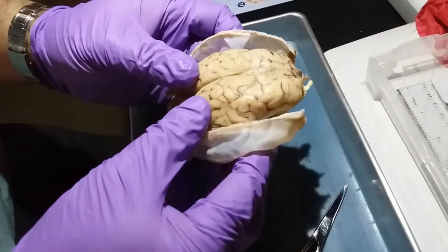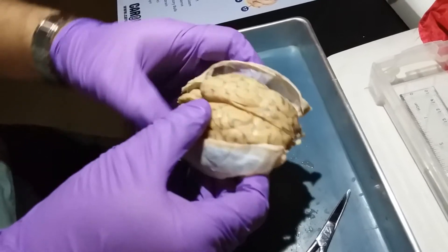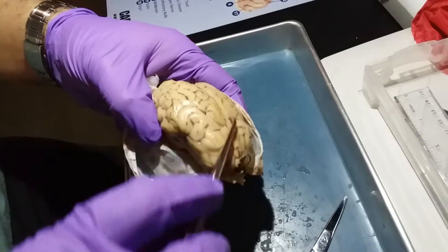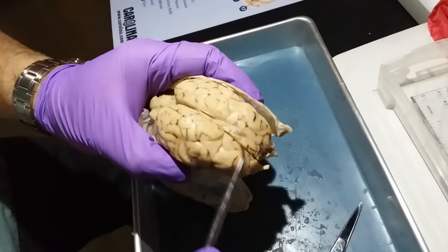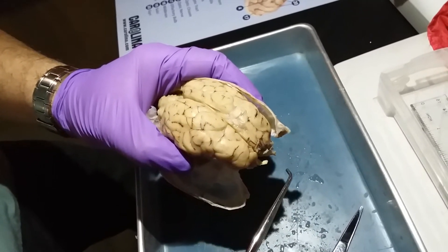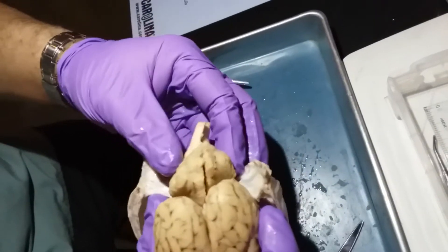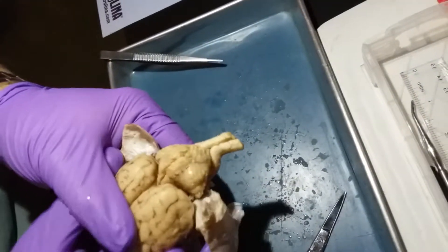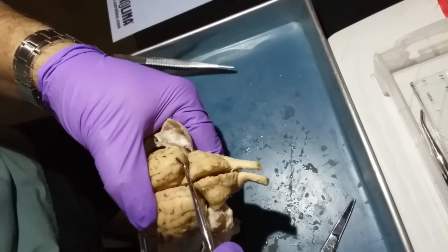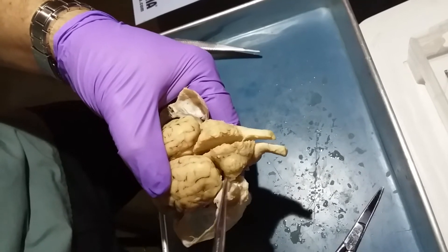Going through the structures: the first one is the cerebrum. The cerebrum is this whole area right here — this is the right hemisphere of the cerebrum and this is the left hemisphere. The cerebellum, which means 'little brain,' is very nicely shown here in the back. Above the cerebellum, below the occipital lobes, is the tentorium cerebelli, which you have to cut on the sides in order to release it.